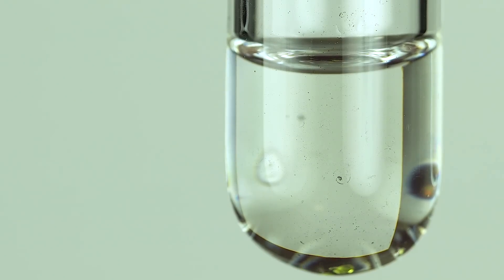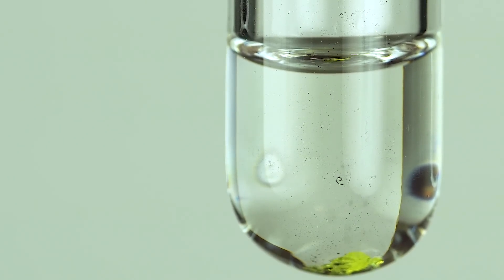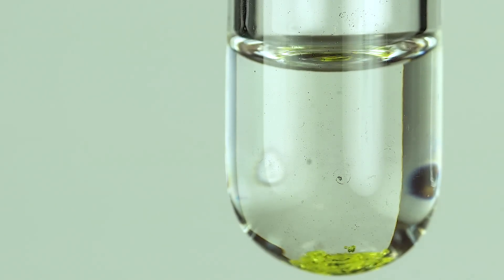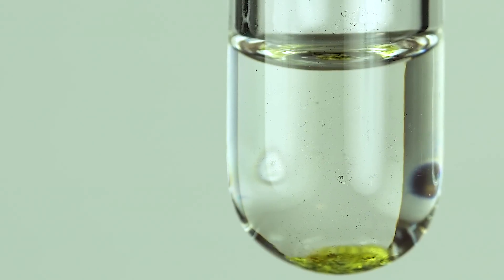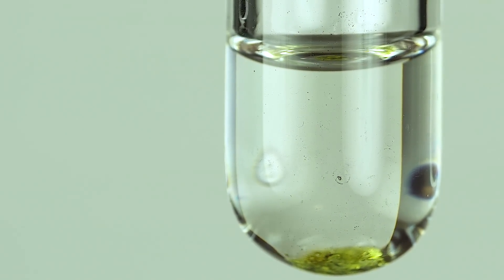Let's add some crystals of rhenium 7 oxide into a hydrogen bromide solution. The reaction takes place in a boiling solution.